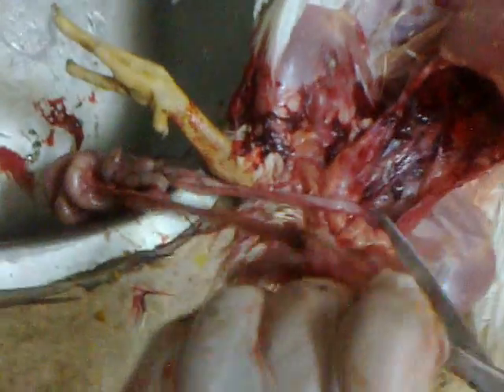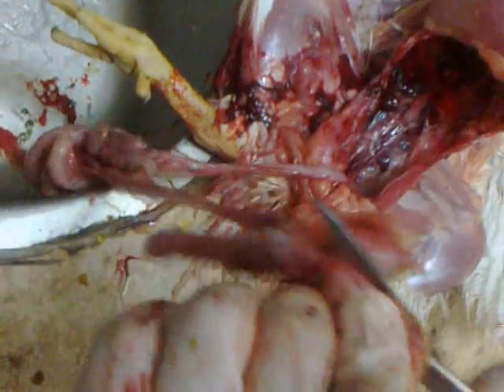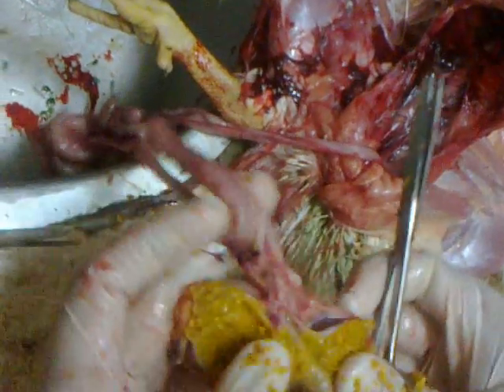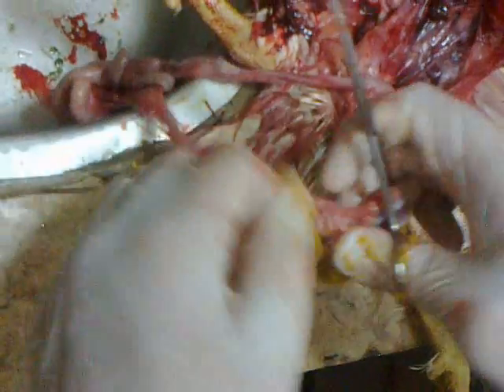Checking the intestine: the main infections of the intestine are cholera and coccidiosis, especially here in Egypt.